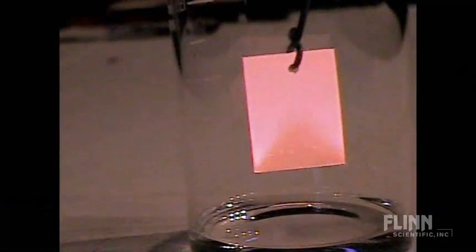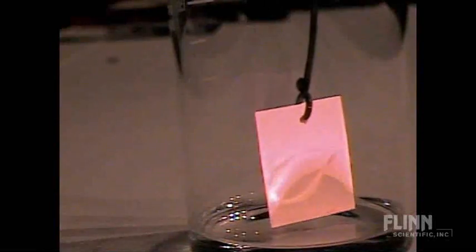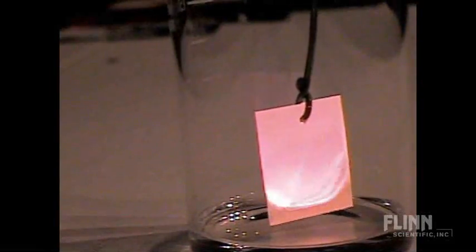Okay, now we're going to take this guy, and yes, I'm going to lower it down over the acetone. Oh God, acetone is flammable. Oh God, what is she doing? Okay, I'm going to put it right over. Okay, here we go into the acetone. Holy cow, it shows up good.